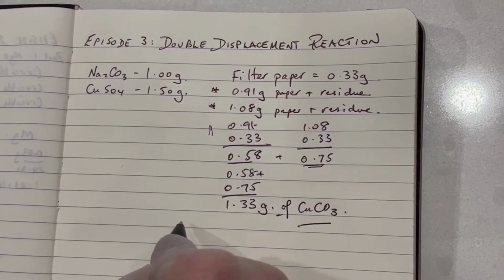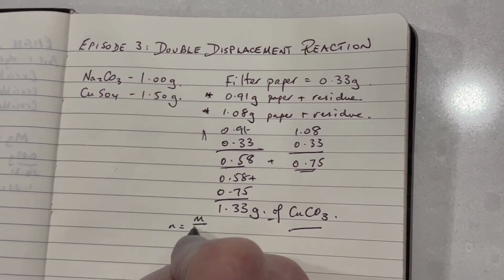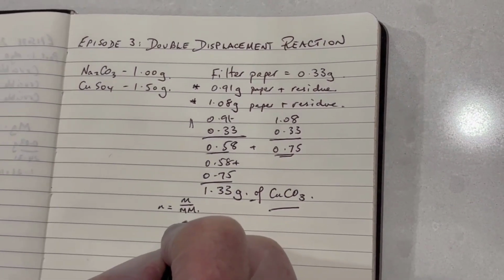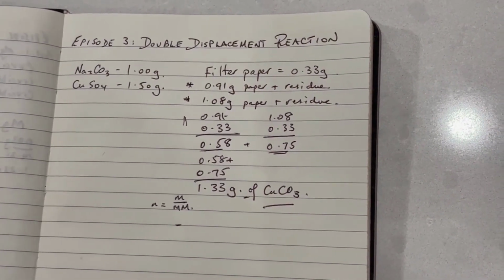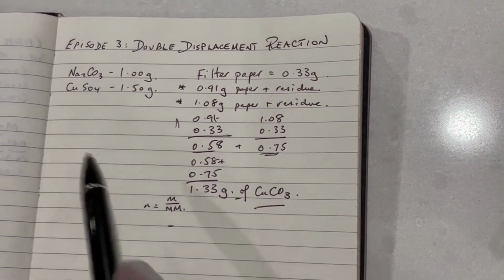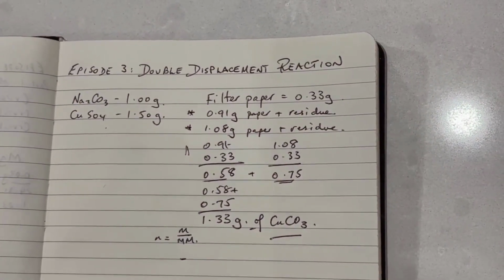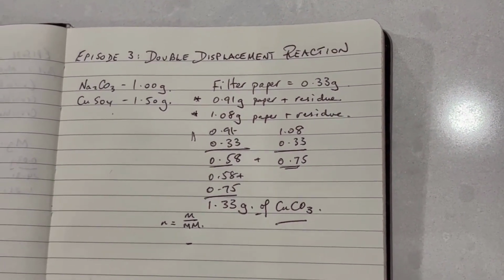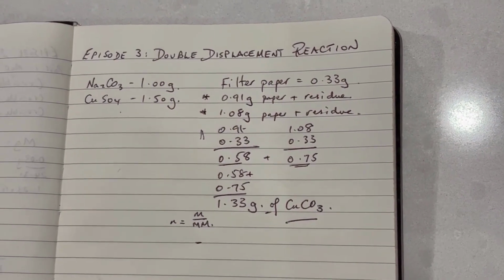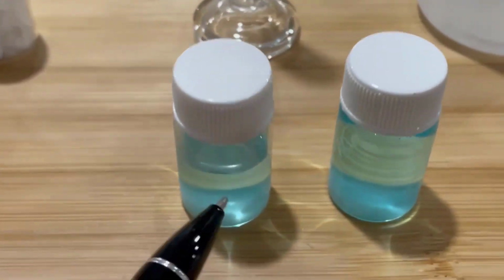So I can convert that to a number of moles by again dividing the mass by the molar mass, and that will tell me how much of my actual copper carbonate I've recovered. I can use my theoretical values from the original part of the experiment to actually see my degree of accuracy. Now, if I'm not spot on, there's two possibilities. One is that I am too low, which means that I haven't recovered all of the copper carbonate, and there's a suggestion from the color of the solutions in the filtrates that that is the case.